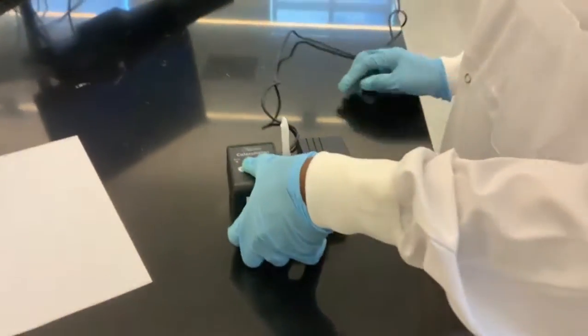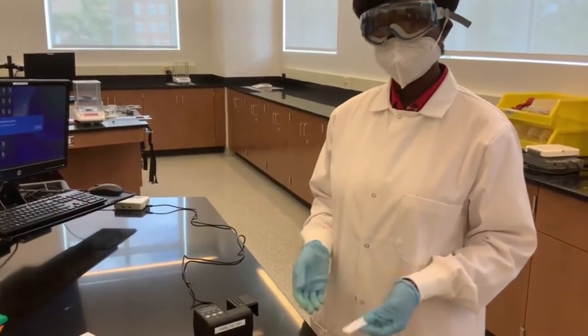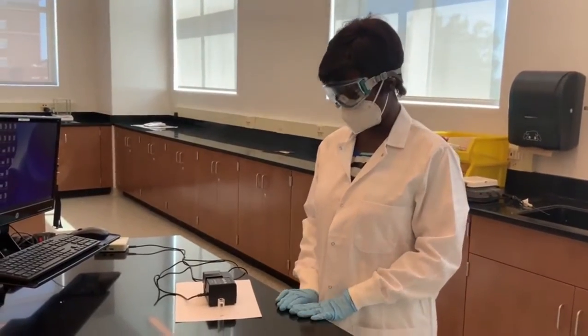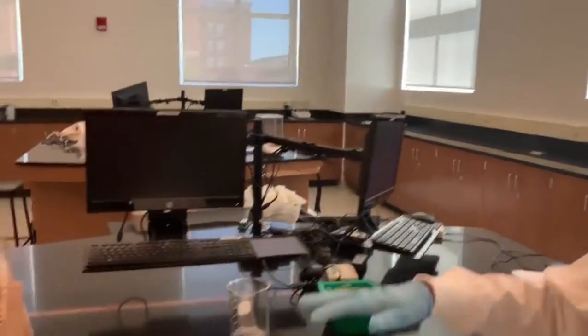Okay. So now that we know the color that these wavelengths correspond to, our next step is to go to part C. With part C of this experiment, what we are going to do is you were given 2 color solutions. The color solution in the 4 groups can be seen here.